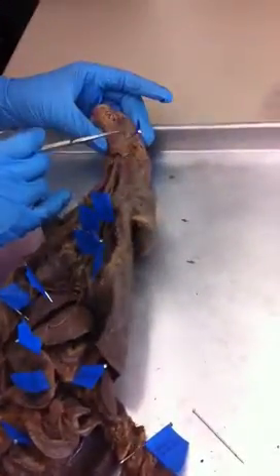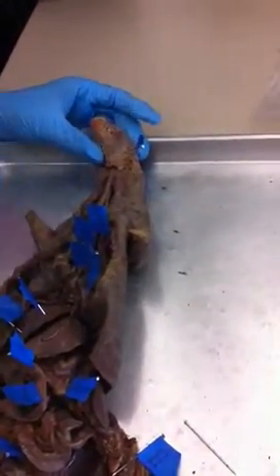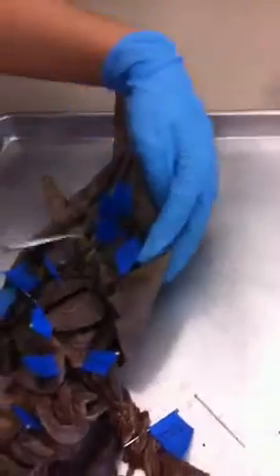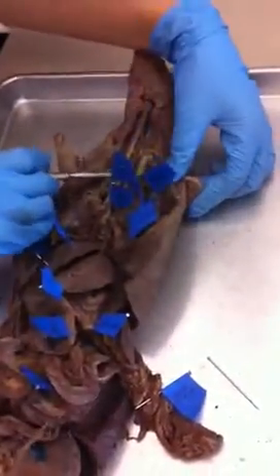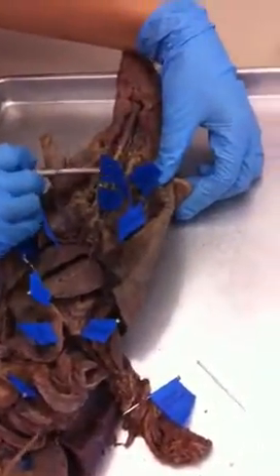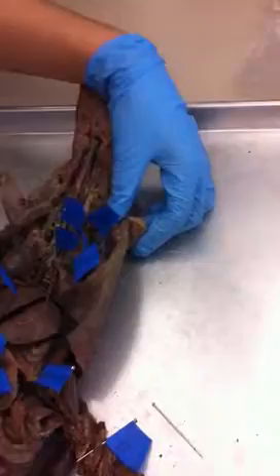Digestive — that's the parotid gland. And then the esophagus; it's behind the trachea, it's a muscular tube behind it.